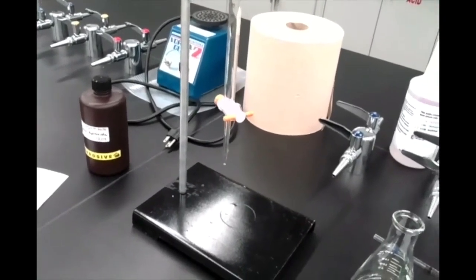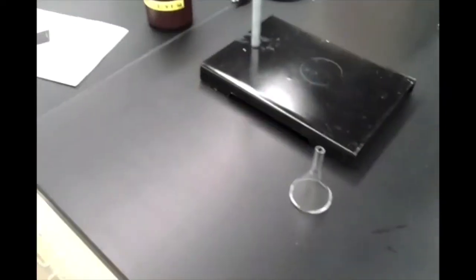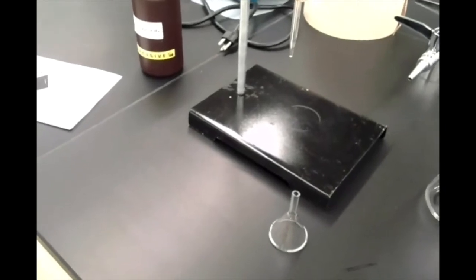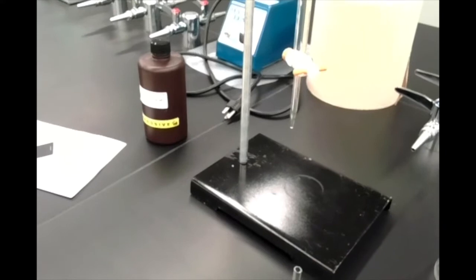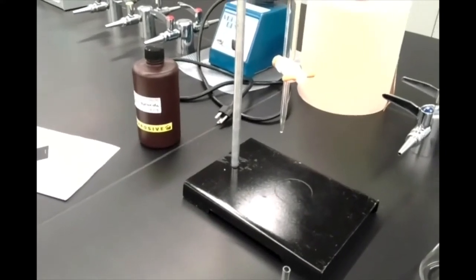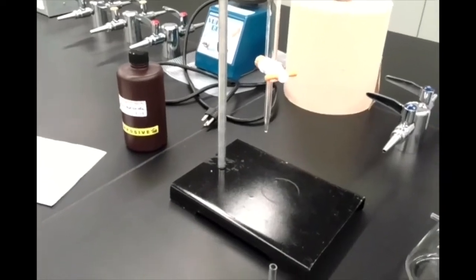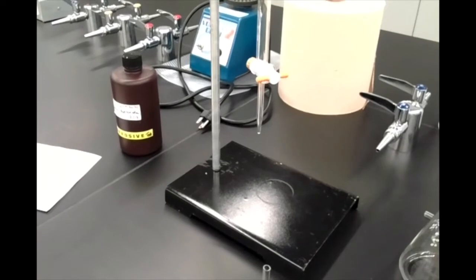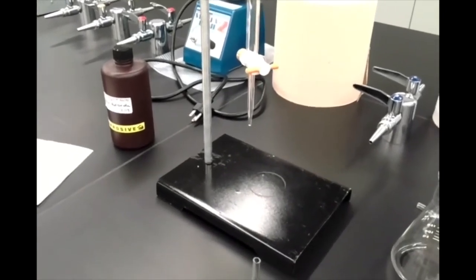So we're going to pour some sodium hydroxide into our burette. We're going to use this little burette funnel over here to help us with that, and basically make a note of the volumes that we're adding through our burette to our vinegar. Okay, so we'll know that we've added enough sodium hydroxide when our phenolphthalein indicator turns pink. And so we'll make a note of the volume of sodium hydroxide that's required to do that.